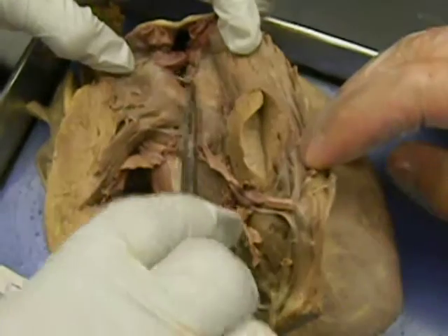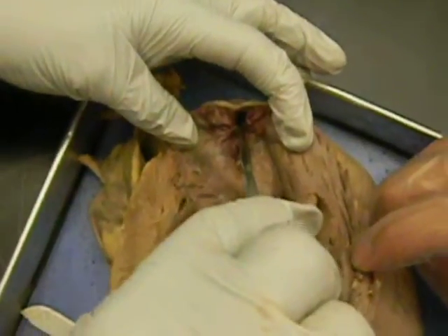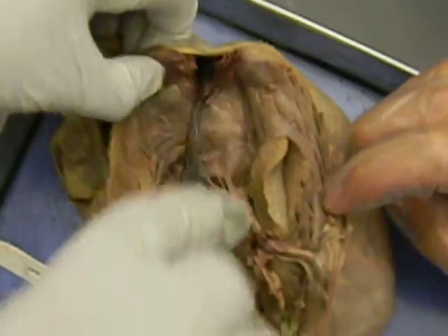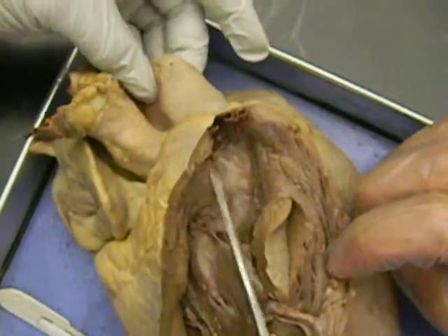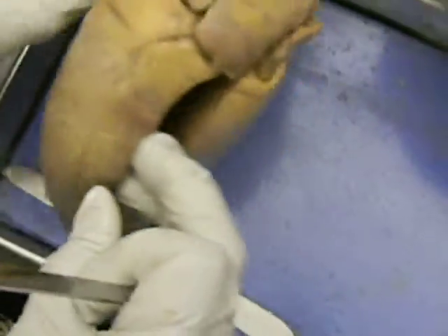You see this flap? These two flaps, that's called the pulmonary semilunar valve if there's a pin here. And if this is inserted like that, that means we are talking about the trunk. Okay? Pulmonary trunk. Now we go to the left side.